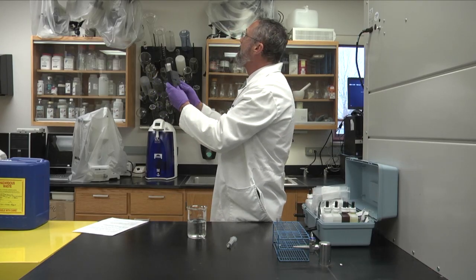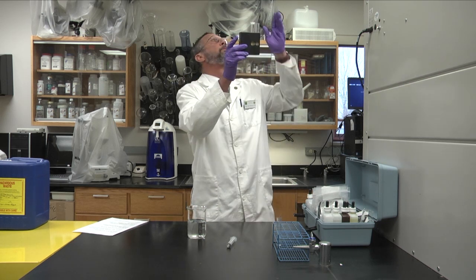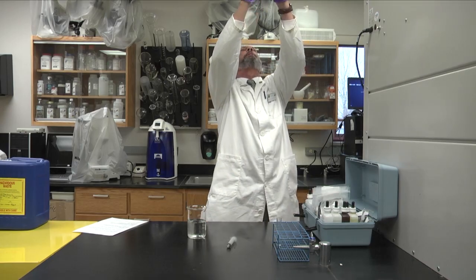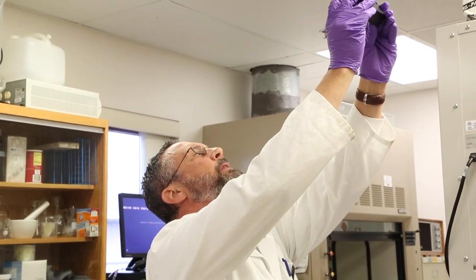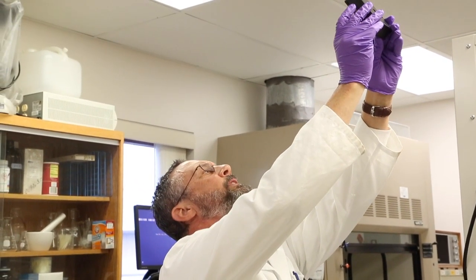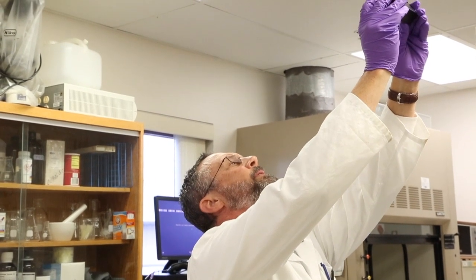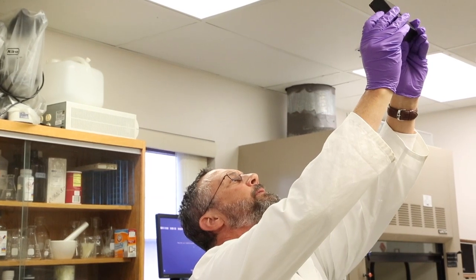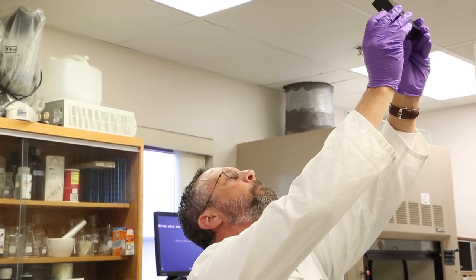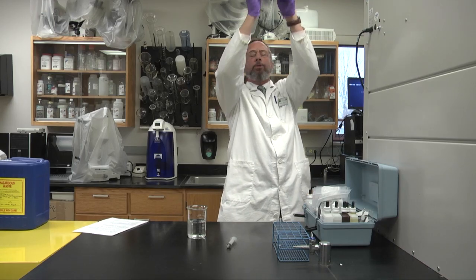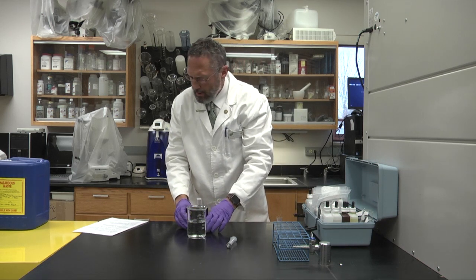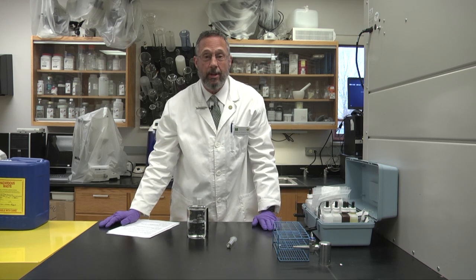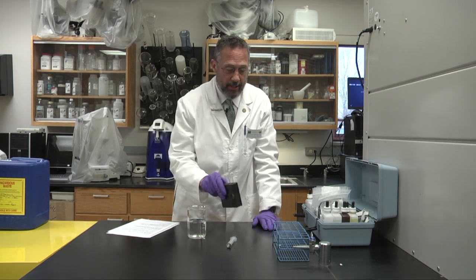Then what I do is I usually hold it up so that I have fluorescent lighting in back of me and in front of me, and I try to match the color wheel reading with the test tube and I get a 1.2 parts per million or milligrams per liter of total ammonia with this test here.